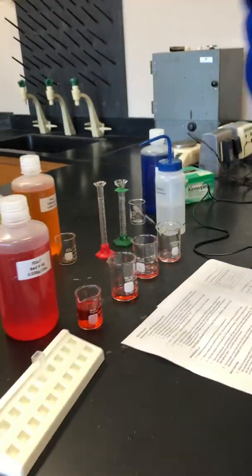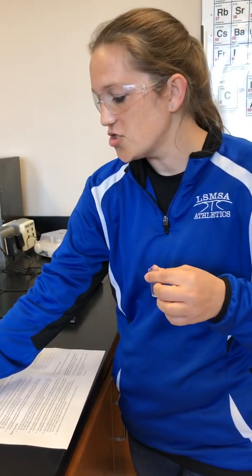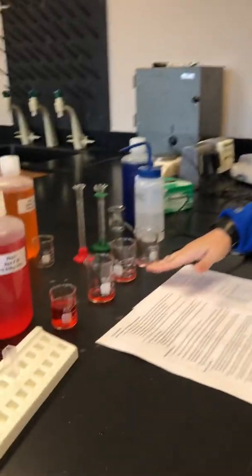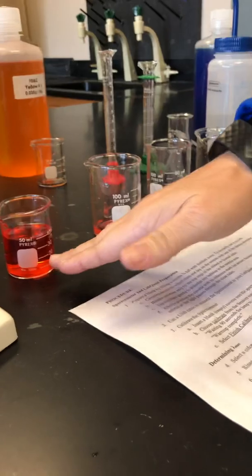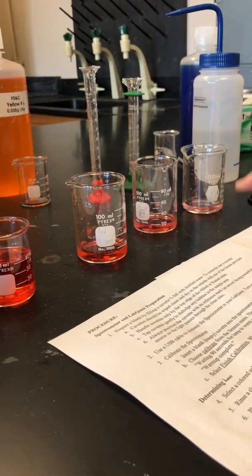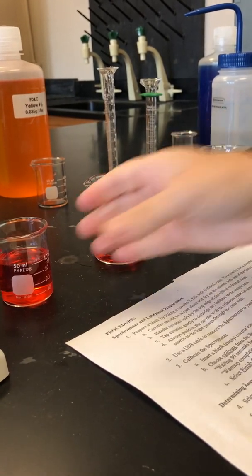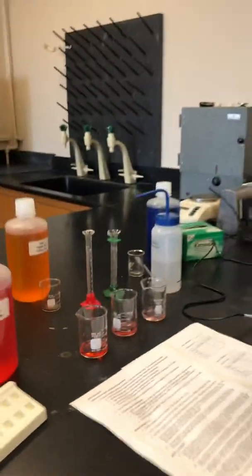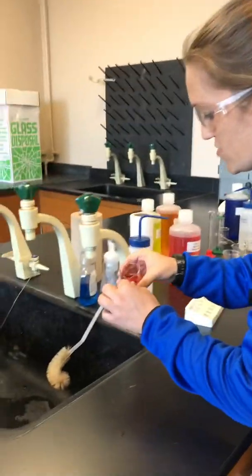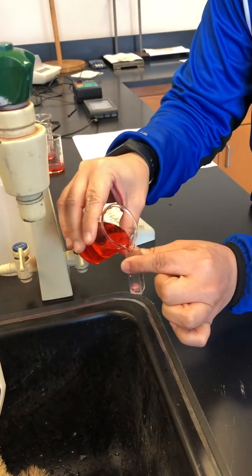So just like before, same process. I have a brand new blank cuvette that I'm gonna use. I have my 100%. You can kind of see, we already made the solutions again. My 100, my 50, my 25, my 12.5. So I went ahead and made all the dilutions. You saw how we did that in the first video. So now we just have to rinse them out. Same thing, you get to watch us pour into these little cuvettes and pour it in the sink. Pour it into the little cuvettes.